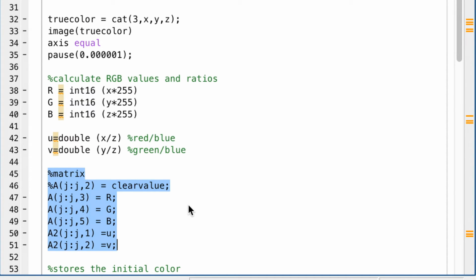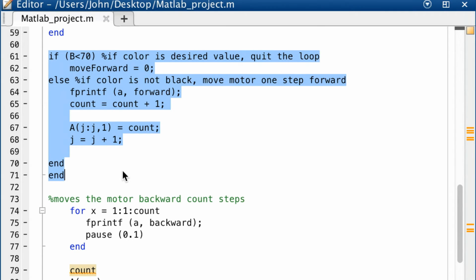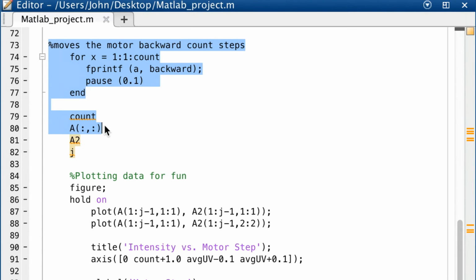This part of the code is to store the RGB and RGB ratio in a matrix. This is the last part of the while loop. The if statement tells Arduino to end the while loop if the desired color is detected. The else statement tells Arduino to turn the motor if the desired color is not detected. When the film turns blue, the loop is exited. If the film is still colorless, the motor will turn again and repeat until it has stretched enough to turn blue. And these lines tell Arduino to move the motor backwards by the total number of steps it moved forward during the entire program. This relaxes the film back to the same position that it started in.